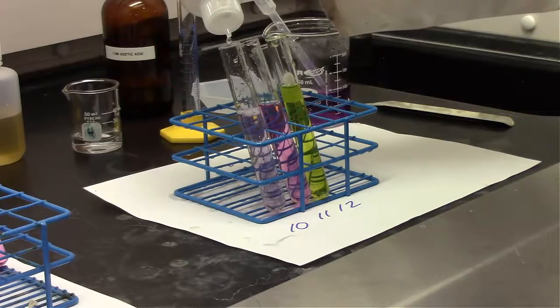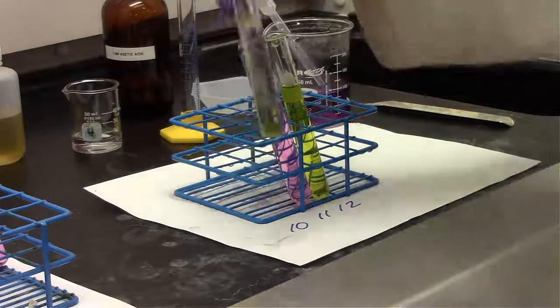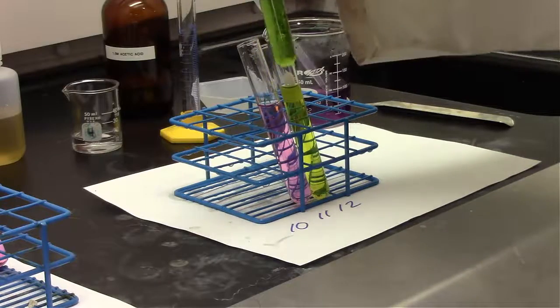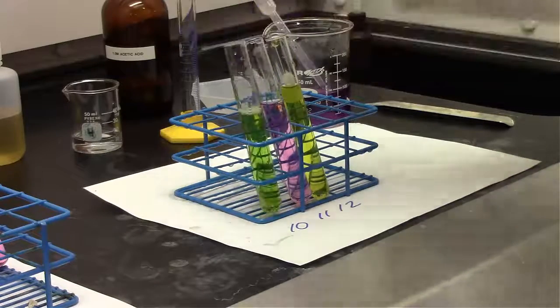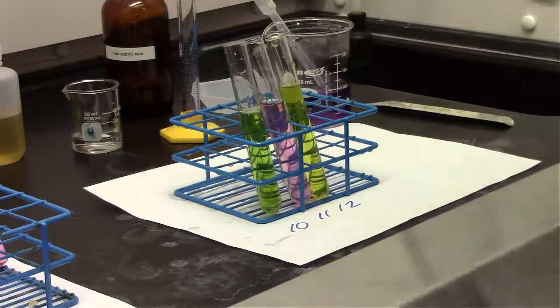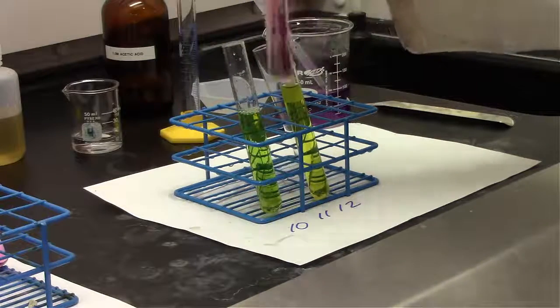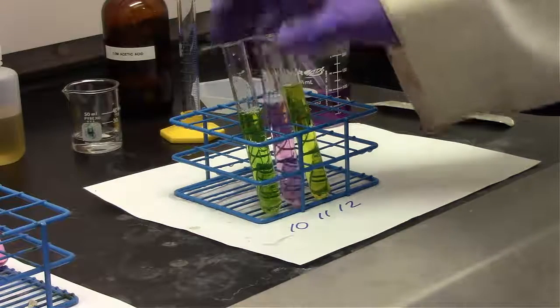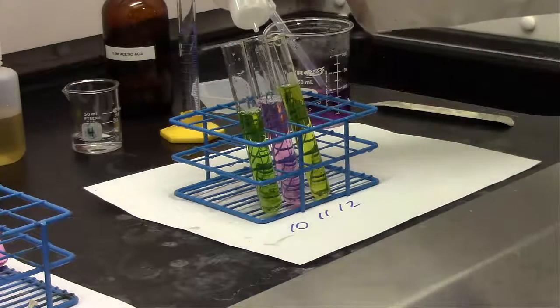We're definitely leaning a little bit more to the bluish purple area at this point. Okay, and then it looks like after a few more drops after that, now we finally got that test tube to be basic. So the buffer solution did pretty well. It resisted that change in pH for a while. Specifically, all of the acetic acid was being deprotonated. And instead of changing the overall pH of the solution, we just increased our concentration of sodium acetate.